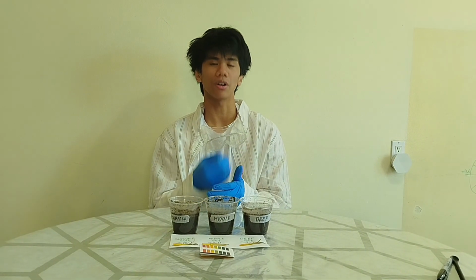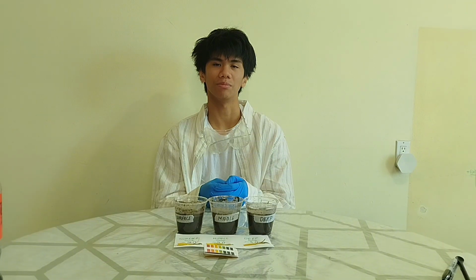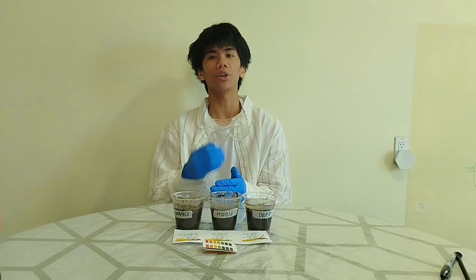Yes, so after the experiment, I can therefore conclude that the soil in our garden is alkaline with an average pH of 8.7. Possible reasons could stem from our fertilizer that we apply 2 to 3 times annually. Our fertilizer could contain high amounts of buffering minerals such as magnesium, sodium, calcium, and so forth. Another possible reason is that our soil was alkaline from the very beginning, meaning it already had those buffering minerals at a high capacity.